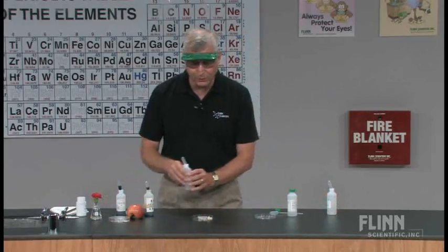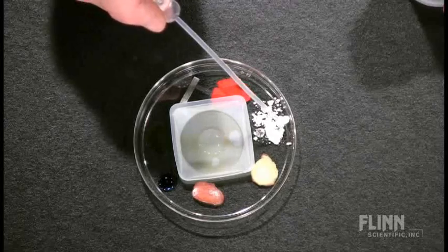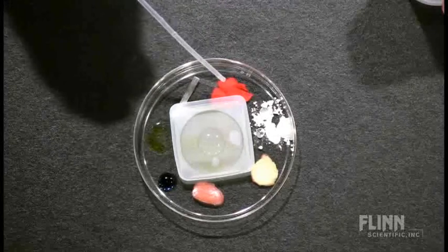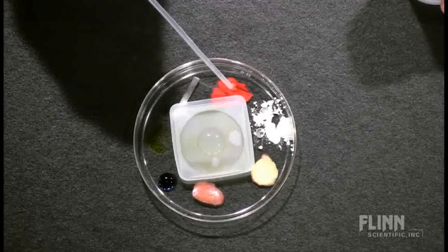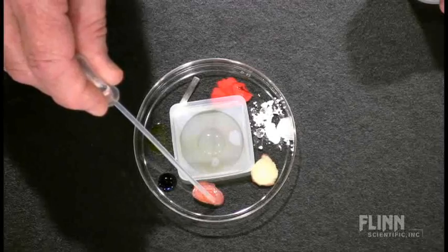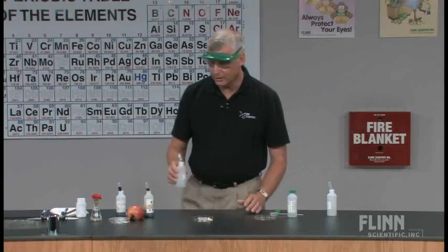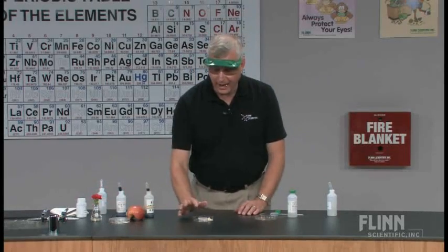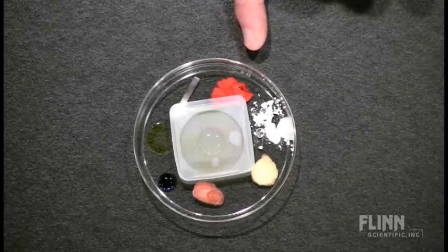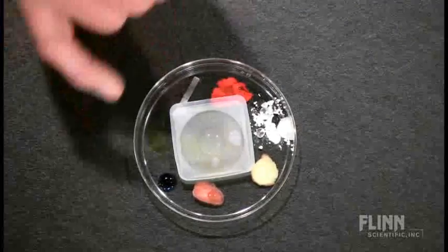I also want to take some distilled water and dampen some of the samples inside. So we're going to put a little bit of distilled water on the calcium carbonate, because acid rain works with liquid materials. We're going to put a little bit of liquid on the flower petal as well, and we'll make sure that the apple skin is damp. We will not dampen the piece of magnesium because we know that magnesium is water reactive, and so we don't want to influence that. So we've got apple skin, apple flesh, dampened calcium carbonate, a dampened flower petal, a piece of magnesium metal, some universal indicator, and some bromothymol blue.